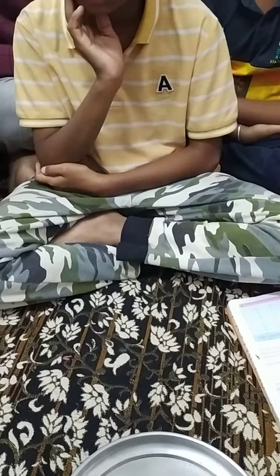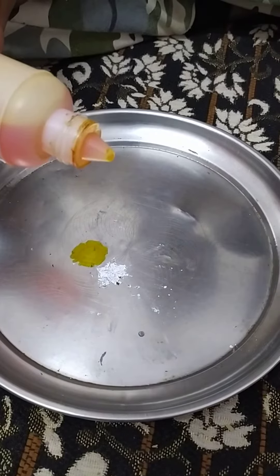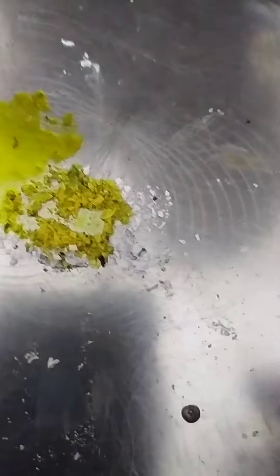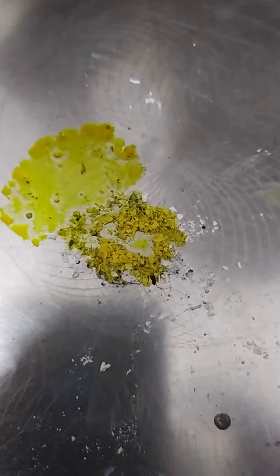We will put one drop on the ash — just pour one drop. That's orange. Wait, stop. You see? It is like yellow — you see? Yes. So what does it indicate? It completely becomes yellow color, you see? Yes. It's basic in nature.